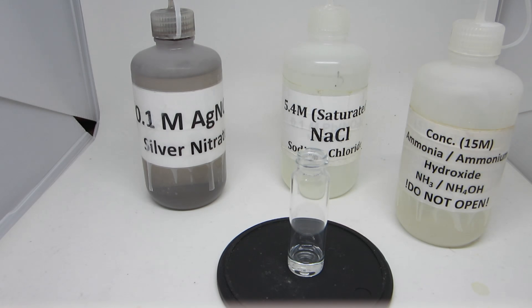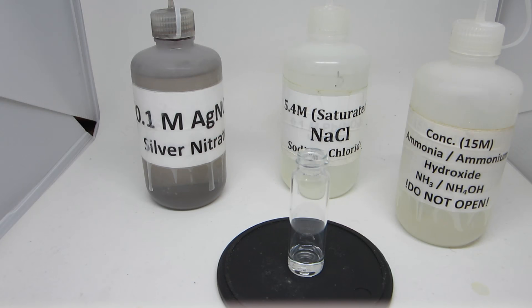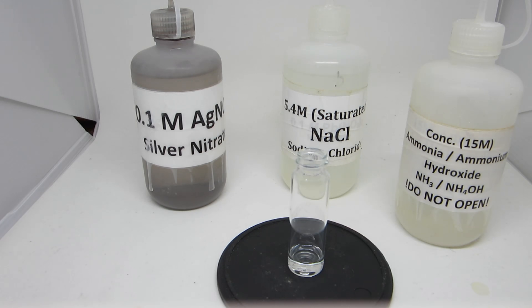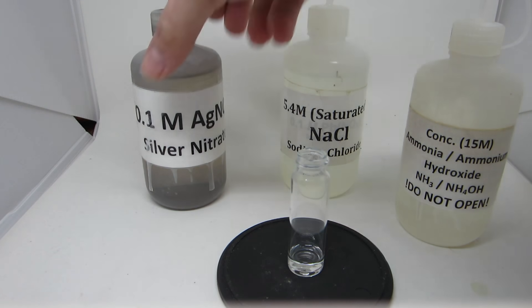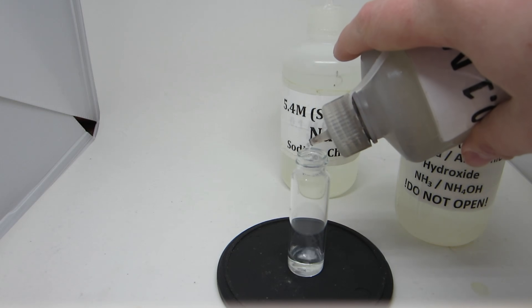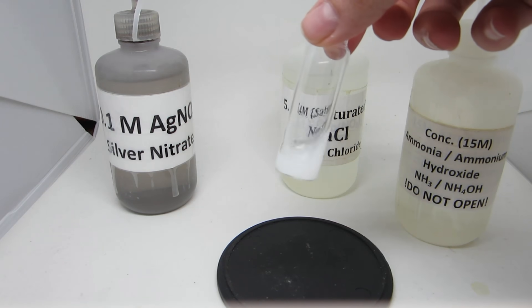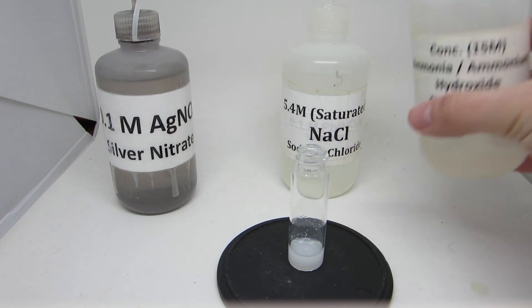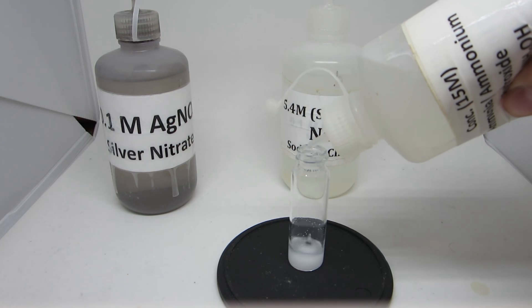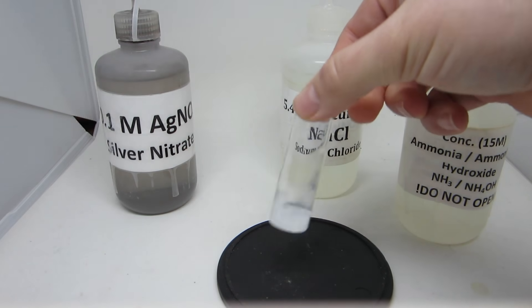The eleventh reaction looks at the complexation reactions between silver and chloride ions and between silver and aqueous ammonia, NH₃. To a saturated sodium chloride solution, upon addition of a small amount of silver ions, the precipitation reaction occurs as was seen in the first reaction. With the addition of ammonia, the precipitate dissolves until you are left with a clear and colorless solution.